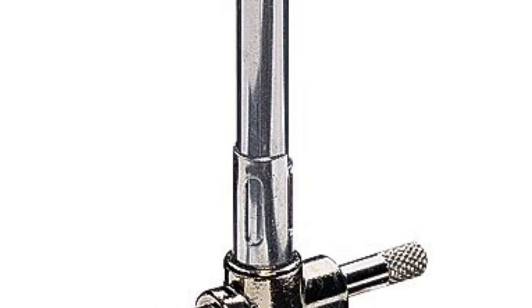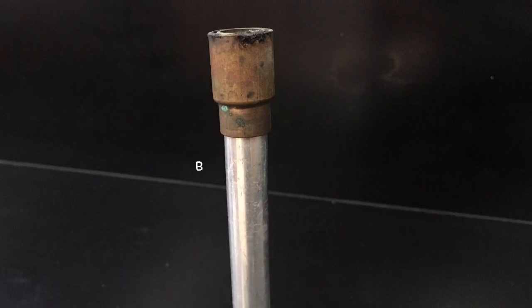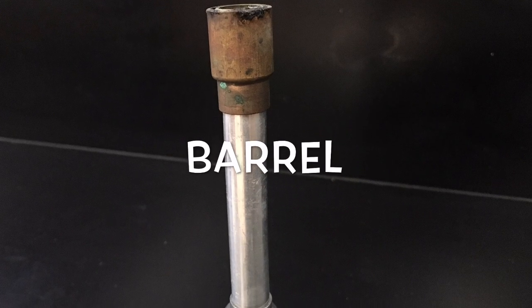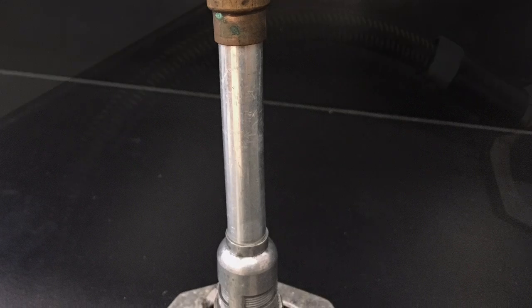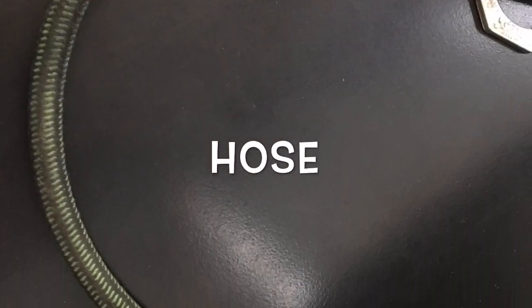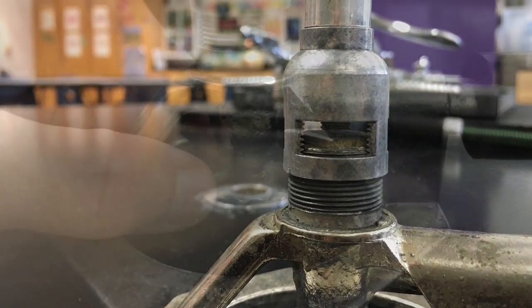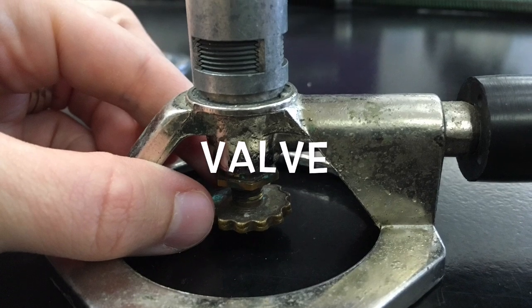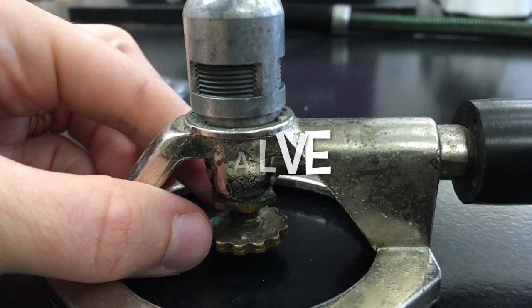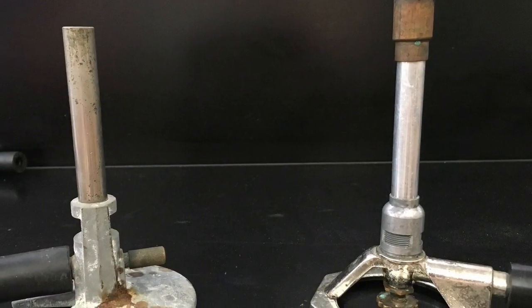Though Bunsen burners may look slightly different, they all have the same basic parts: a barrel where the gas and air travel together to make a flame, a hose or tube that attaches to a gas jet, a vent that allows for air flow, and a valve to adjust the gas flow and therefore the height of the flame.